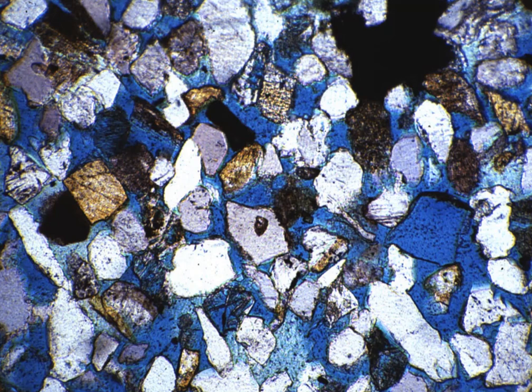Notice here this view is 200 microns across the lower side of the slide. Actually, I'm not sure if the box itself represents the length of 200 microns. That makes more sense to me. Whereas in the past, some of those images were blown up to 50 microns. So we've zoomed out, we're looking around at this. Let's see what we find.